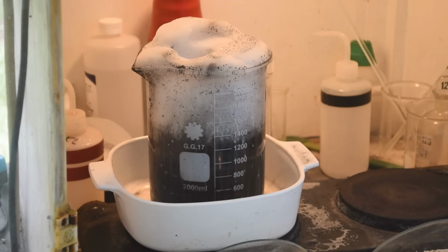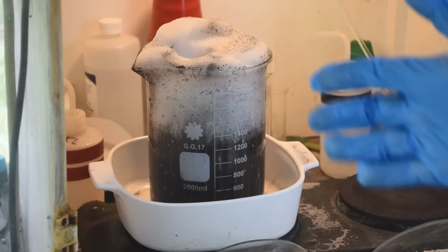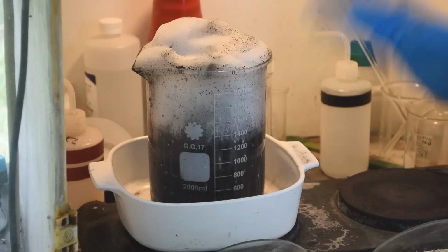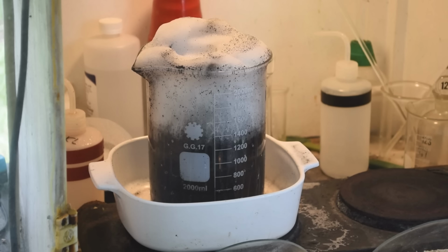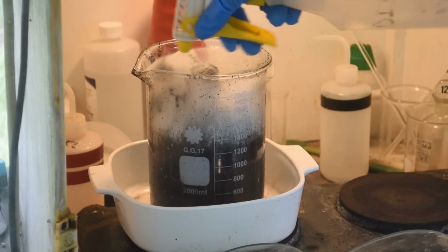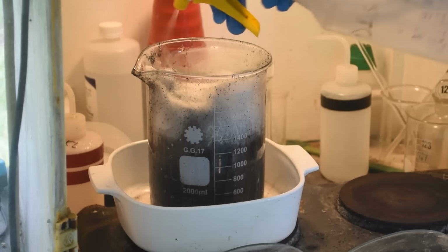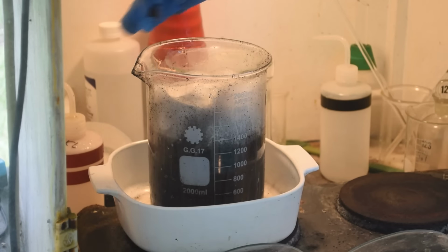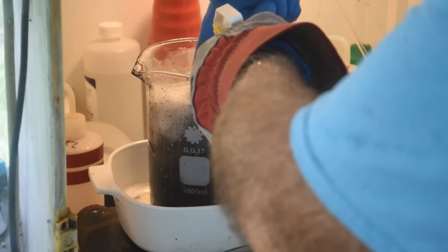All right. Let this calm down a little bit. Now, maybe I don't even need to boil it. Maybe all the palladium will just settle out on its own if I let it cool down. I guess we'll find out. Yeah, there's a lot of chunky palladium. Get it stuck to the outside. Yes, on the outside. Look at that.